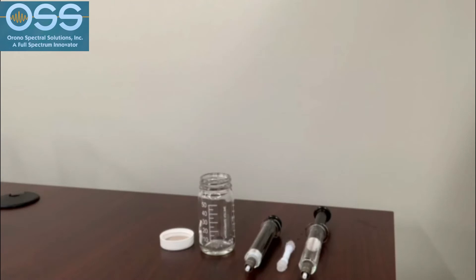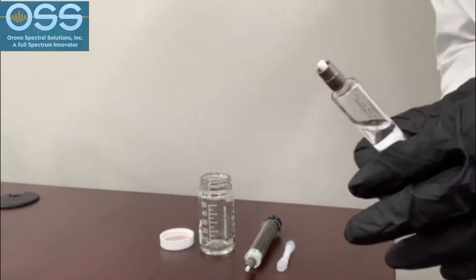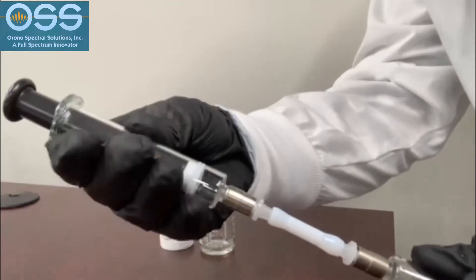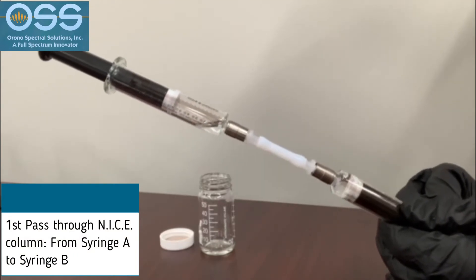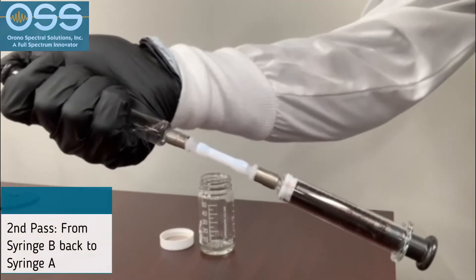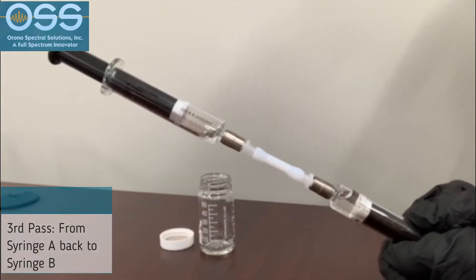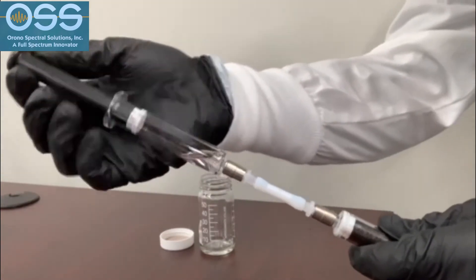At this point, we are ready to separate the polar portion from the total oil in the system using the OSS NICE column. First, attach this column to the syringe holding the sample, which we will refer to as syringe A. Next, attach an empty syringe, which we will refer to as syringe B, to the other end of the column. Push the sample through the column from syringe A to syringe B. Then reverse the flow by pushing the sample from syringe B to syringe A. Once more, push the sample through the column from syringe A back to syringe B. Pull on syringe B plunger to ensure that all of the liquid has passed through the NICE column.